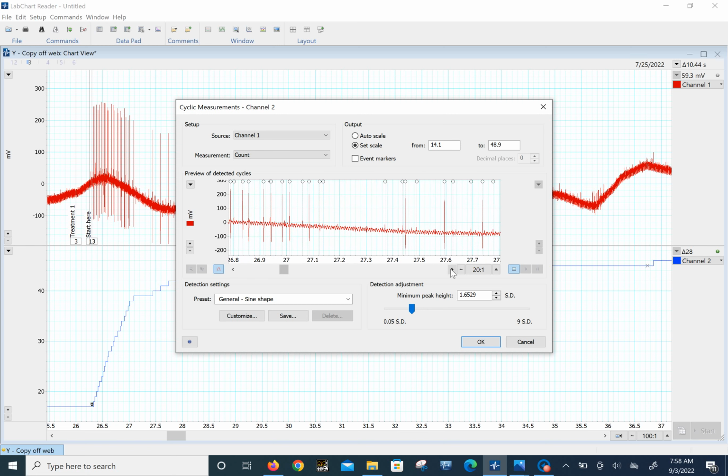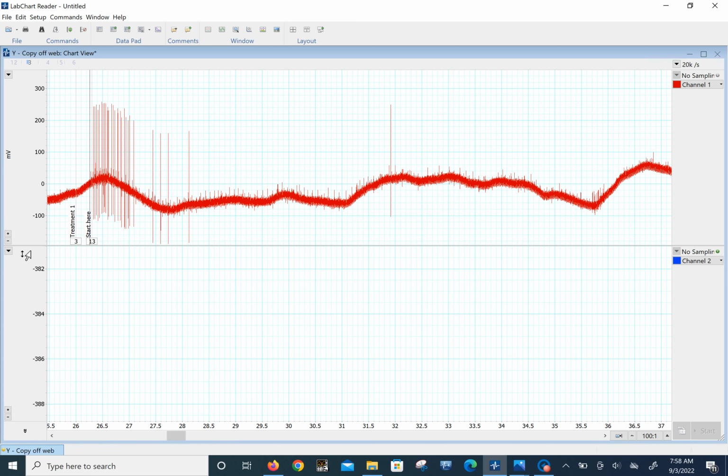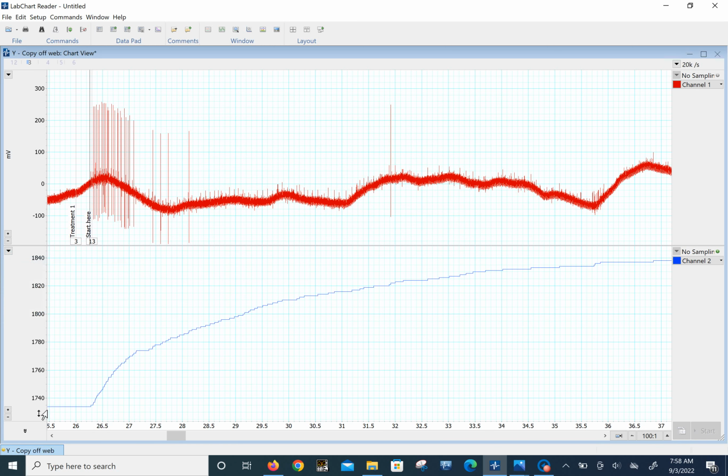It would be nice to take the noise level and double it. So you take that noise and make it twice as large, and you probably wouldn't count these smaller ones. You might get that one right at the limit of it. So usually about 2 times the size of the noise, the thickness of the noise, is where you want to call it. So this one is a standard deviation of 1.6529. Let's see what we get here. If we could do auto scale there, take the little marker, and now move it on over here until we get to 10.